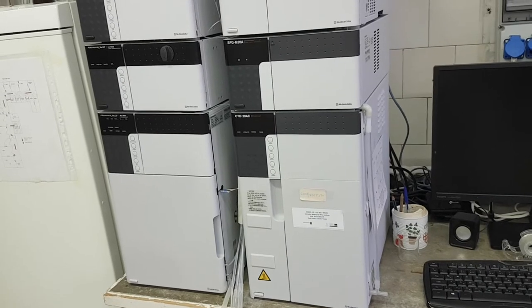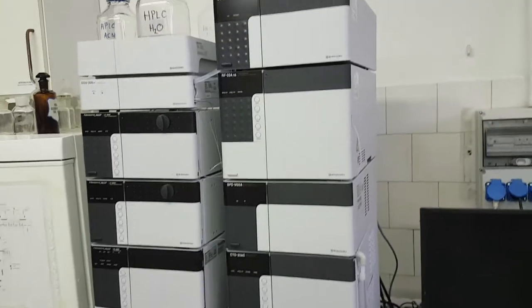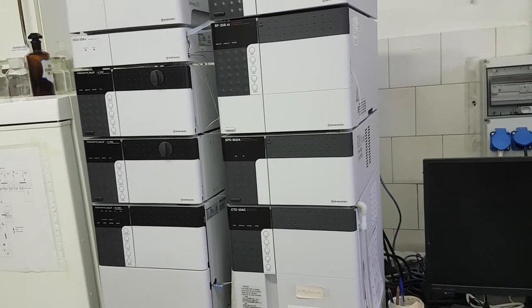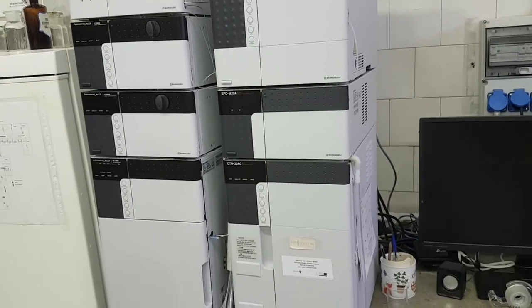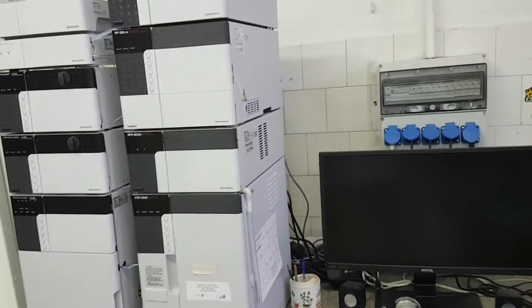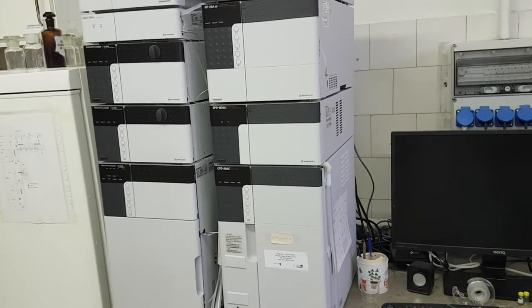This is the preparative HPLC — it is very sophisticated. You can also use flash column chromatography or other methods, as there is a variety of chromatography techniques available. You can also use supercritical fluid HPLC. The most important goal is to get a high purity of your molecules. Here we have different HPLC systems — this one and also this older one — it depends on your molecule and your main compound of interest.